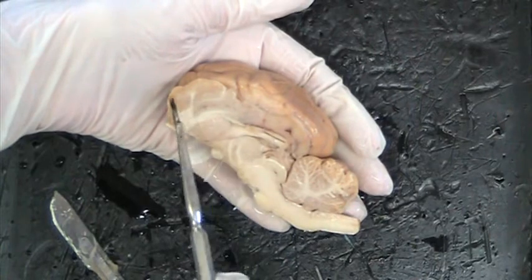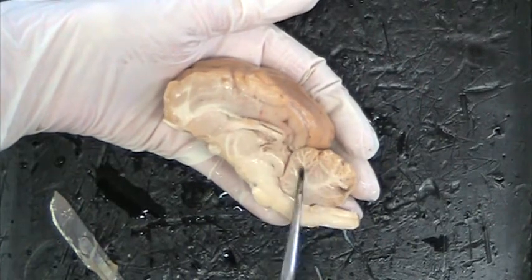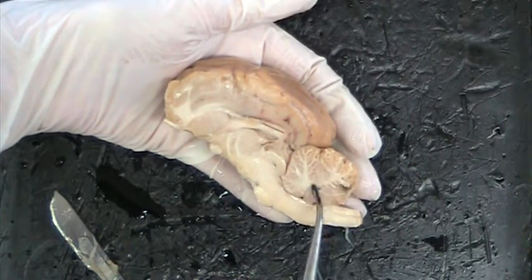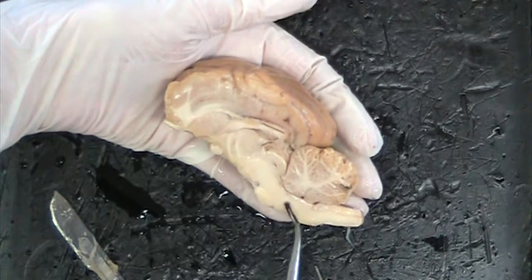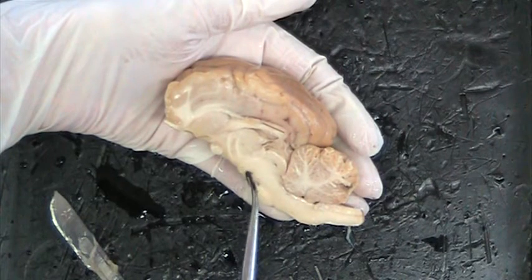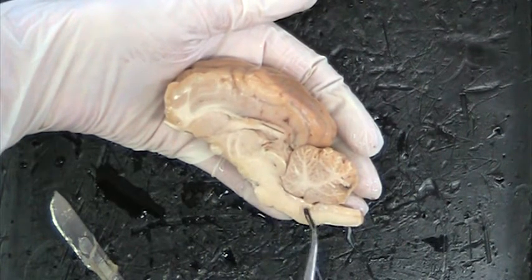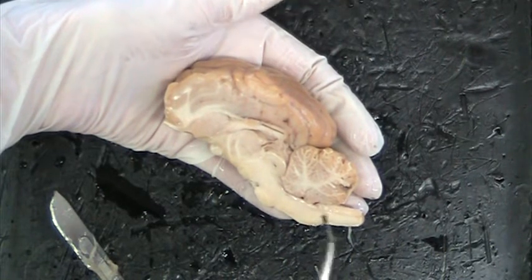First off, again, this is the cerebrum, the large part of the brain. The little brain or hindbrain is the cerebellum, and in that cerebellum you can see the arbor vitae, or tree of life. And here again is the brain stem, made of the top part, the midbrain. The first bump is the pons, and the next bump is the medulla oblongata. And of course, when the brainstem comes out of the skull, it becomes the spinal cord.